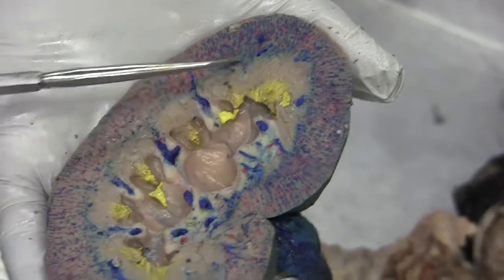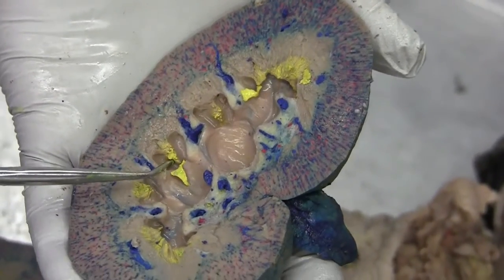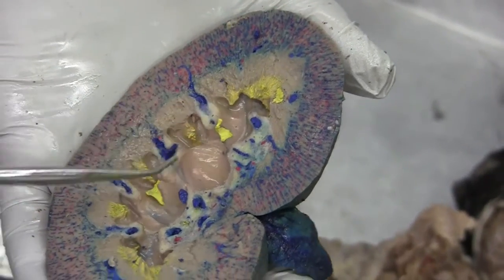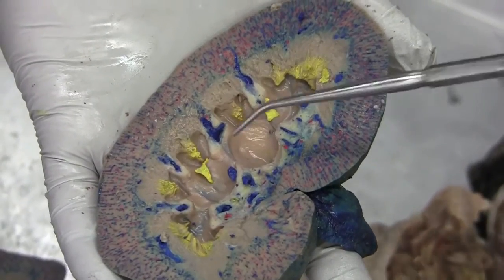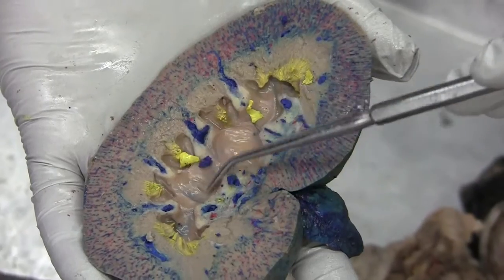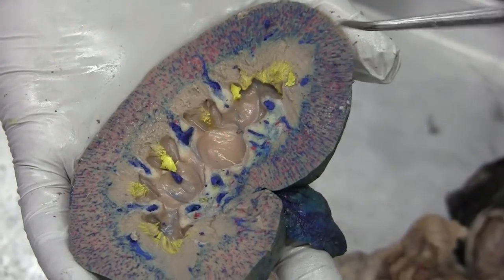And the calyx — the calyx minor, right here, these yellow things at the bottom of the pyramid. And the calyx major — these. The minor ones flow into a major. So these minor ones flow into a major.